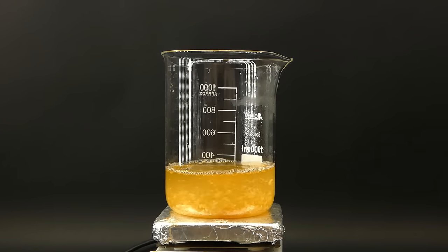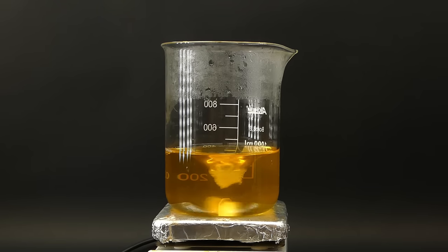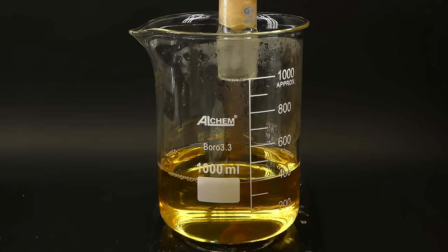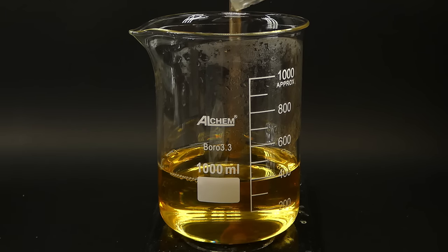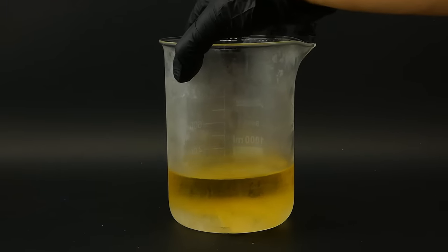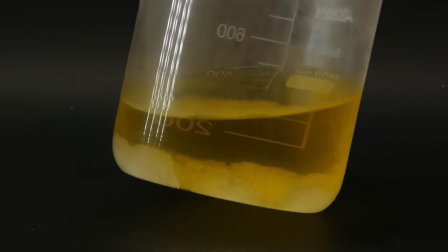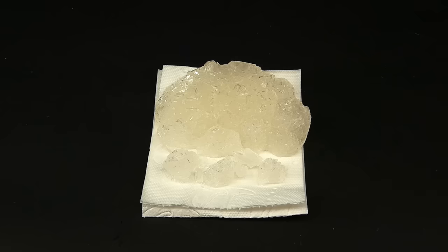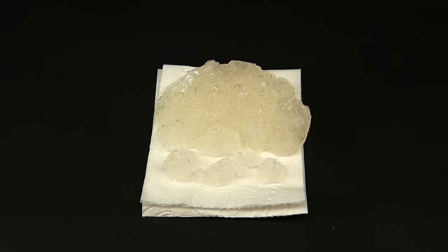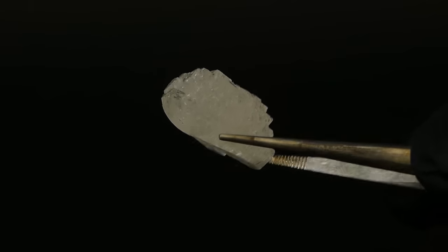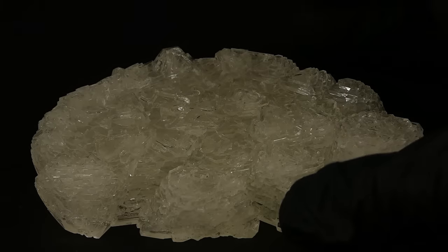Anyway, to finish making the alum I heated this mixture up to get the potassium sulfate into solution and then filtered everything through some cotton to get rid of this random cloudiness. I then got the alum solution into a fridge to crystallize some of it out. When I came back the next morning a large bed of crystals appeared in the beaker, meaning that I actually successfully made the alum, which made me really happy.